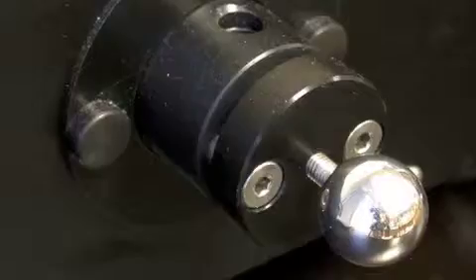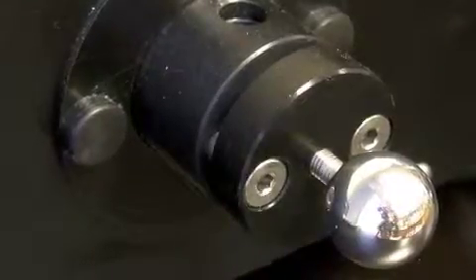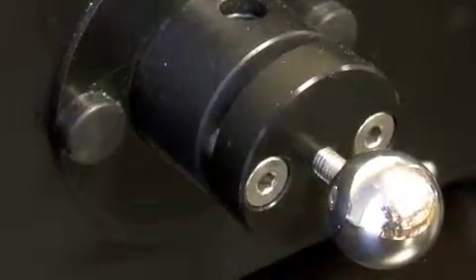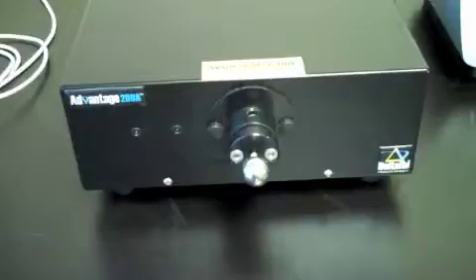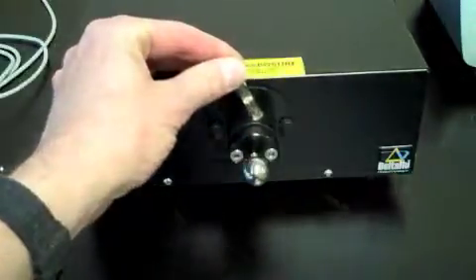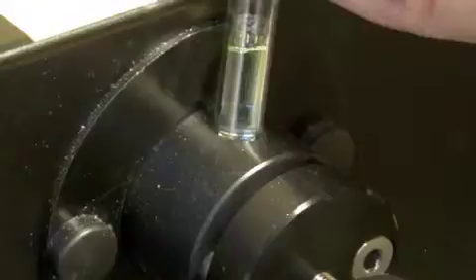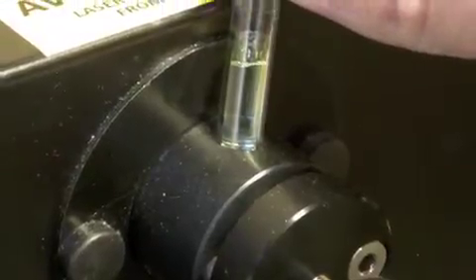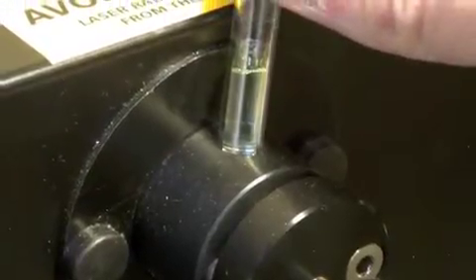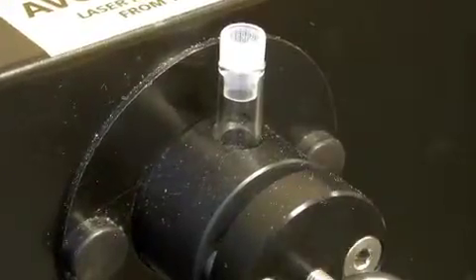We will use glass sample tubes that are about two inches long and a quarter of an inch in diameter. These small tubes fit in the small opening on the front end of the spectrometer between the box and the shiny round knob. Either solid or liquid samples can be examined using this type of sample tube.